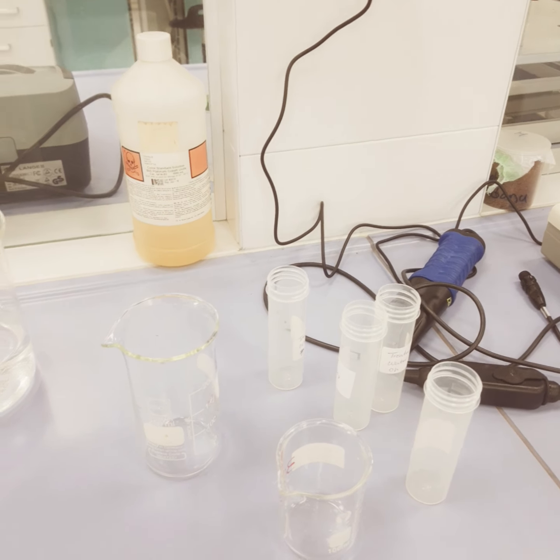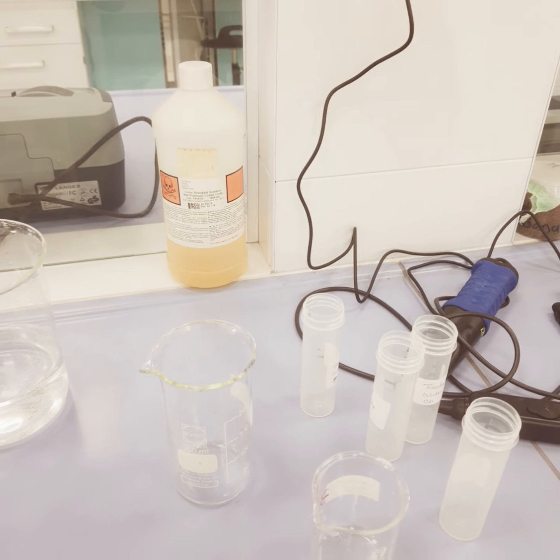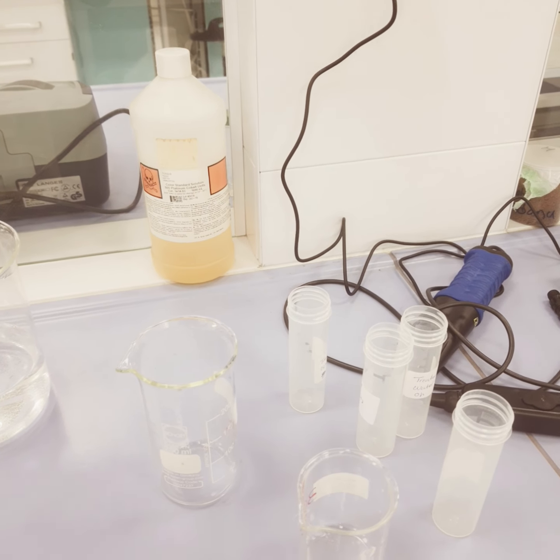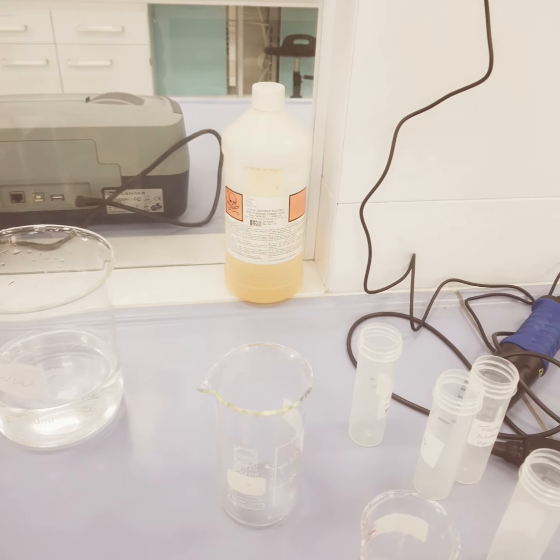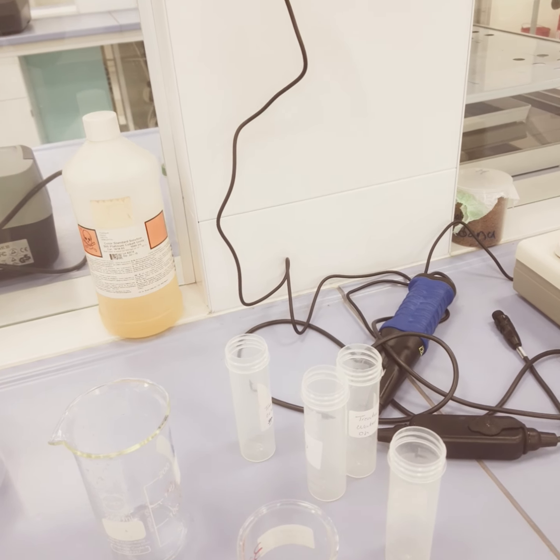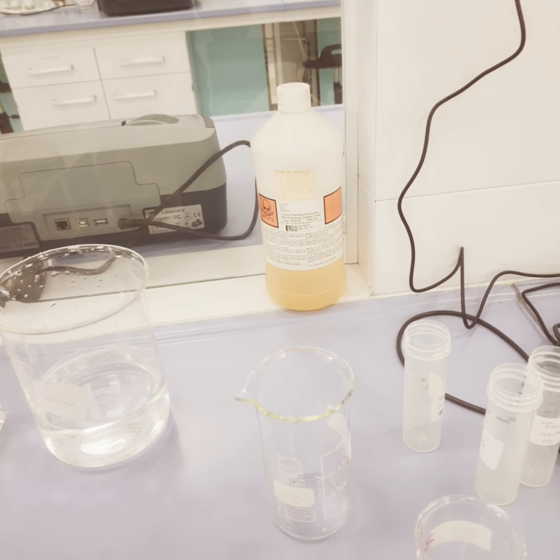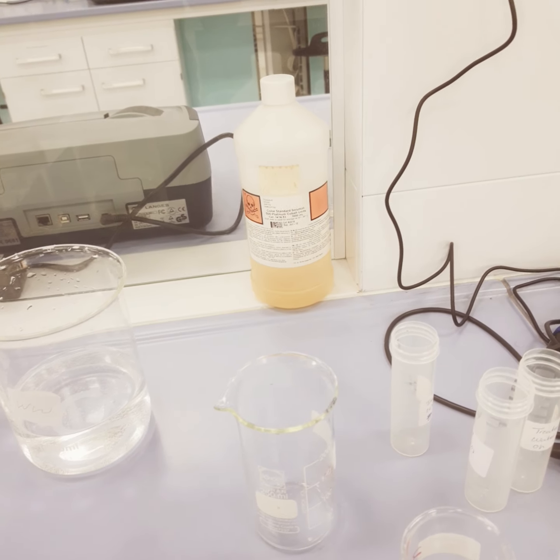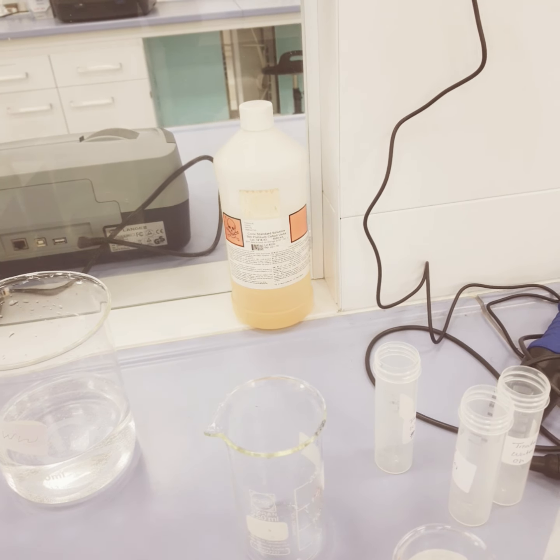Since pure substances have unique density values, measuring the density of a substance can help identify the substance. Density is the mass of a substance divided by its volume, and the unit is commonly expressed in gram per centimeter cube for solids, gram per ml for liquids, and gram per liter for gases. This is also an intensive property of matter.